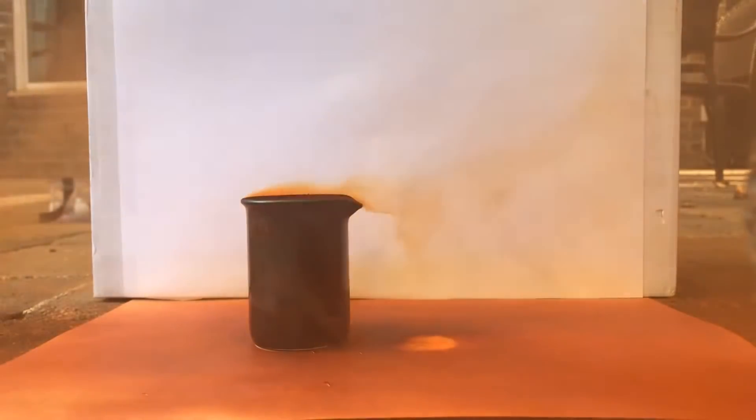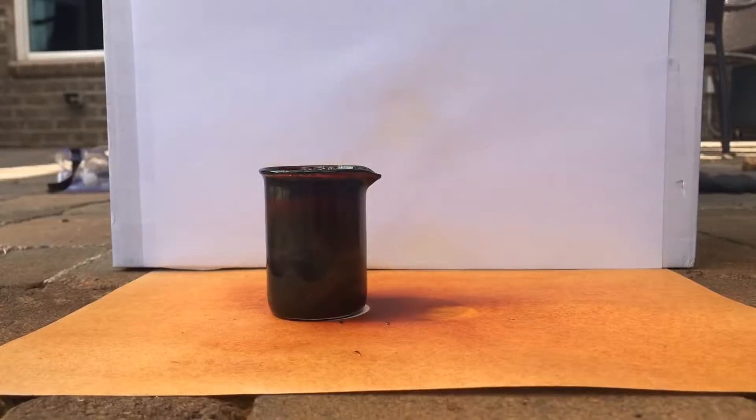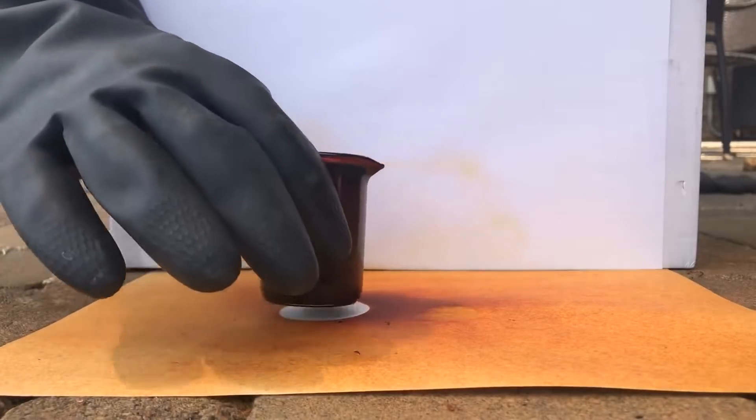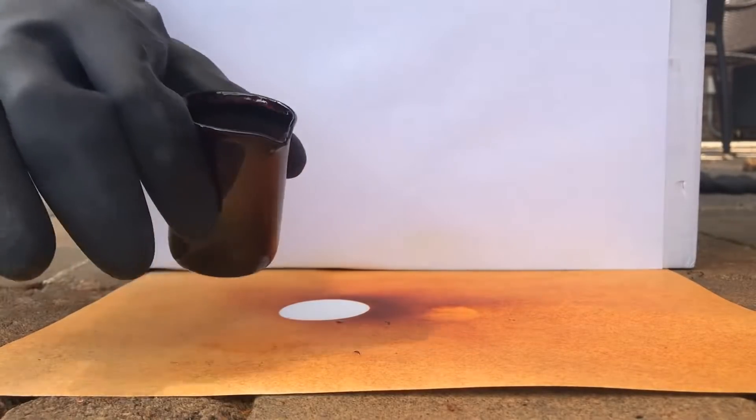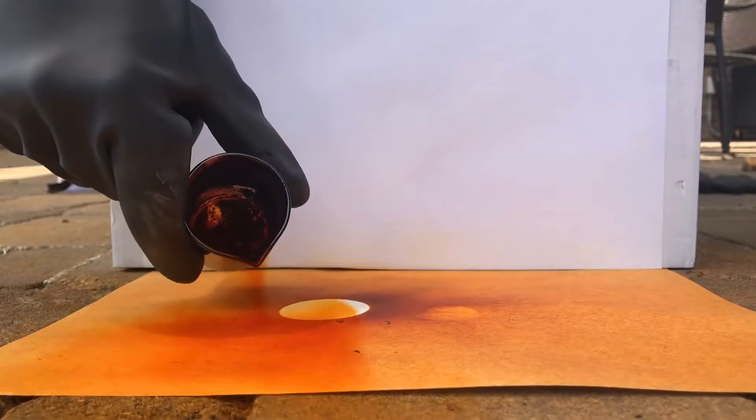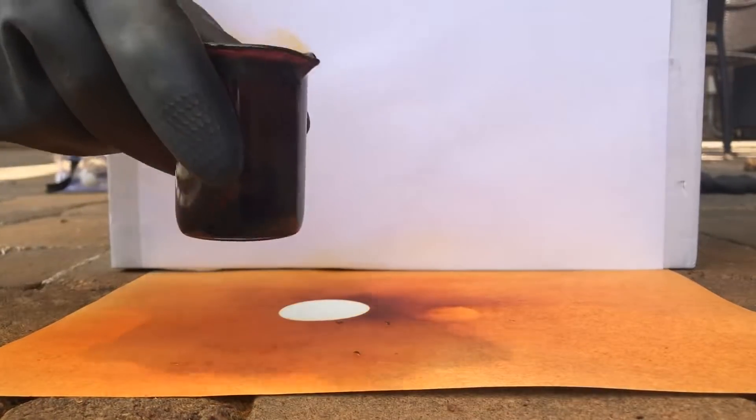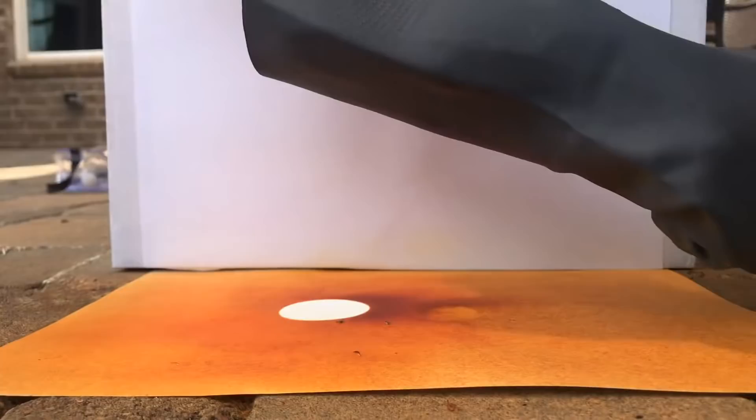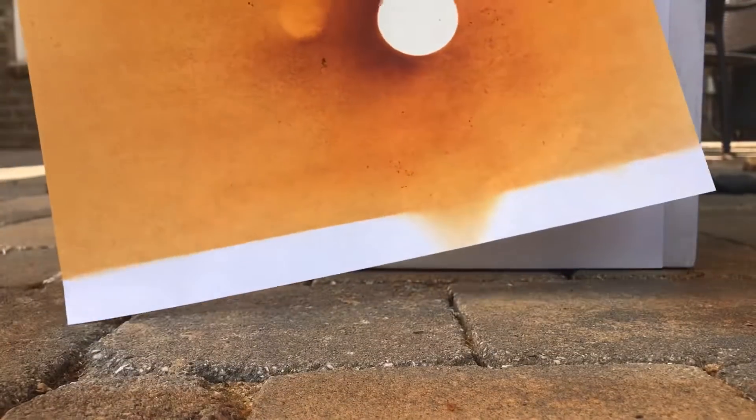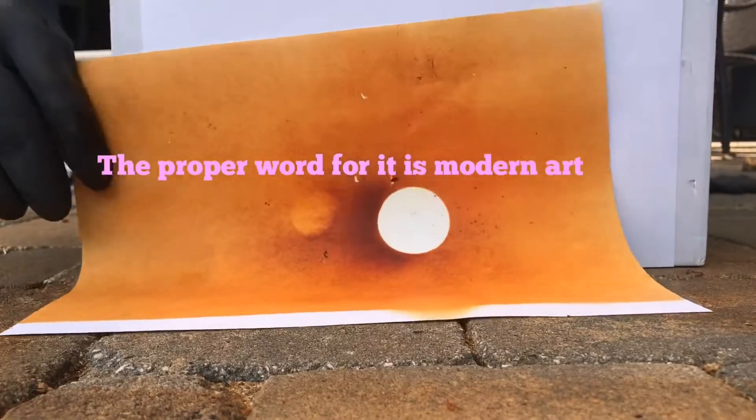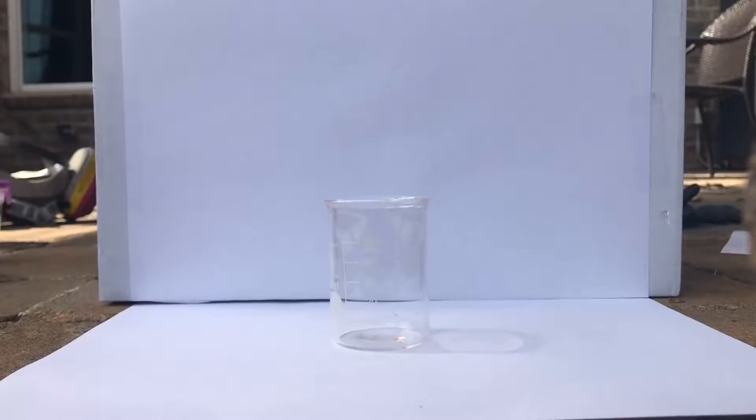Let's take a picture. Alright, so that was a pain to start. So let's see the damage. Yeah, this is hot, and not cracked, so that's good, we'll put that off to the side. The paper, however, oh my god, that is destroyed.